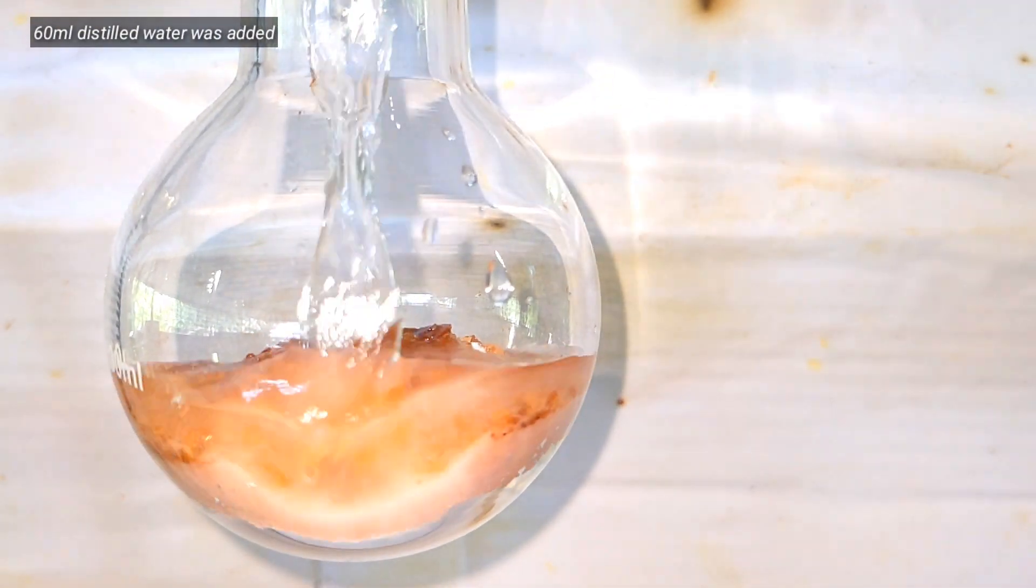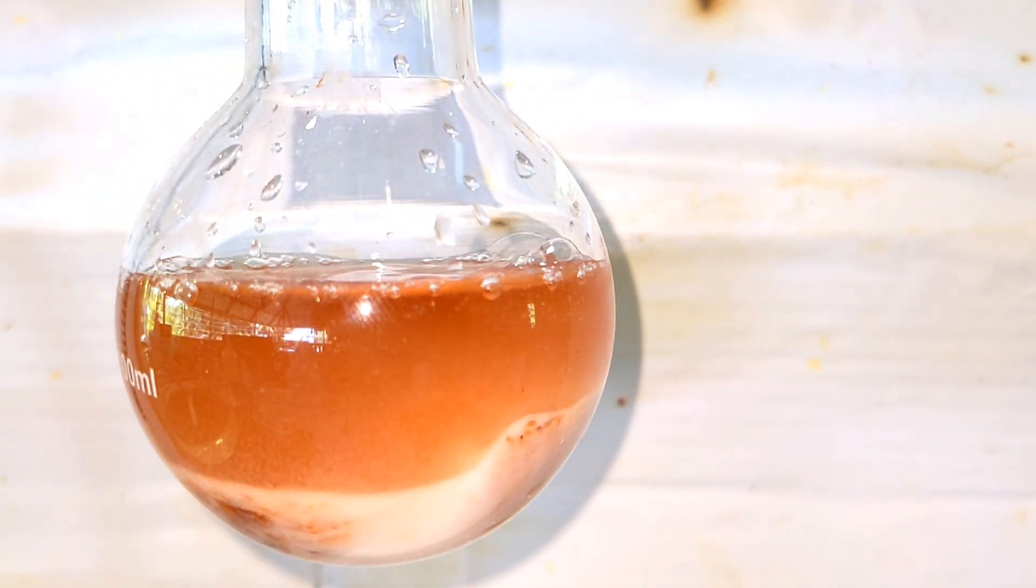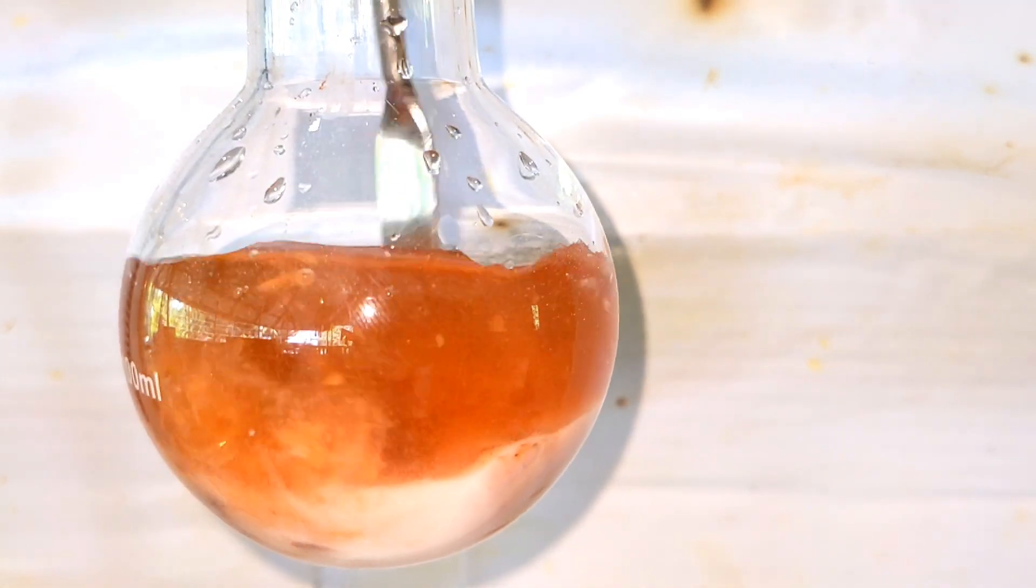Now 60 milliliters of distilled water was added and it was mixed well. I used a spatula to just mechanically stir the compounds around.